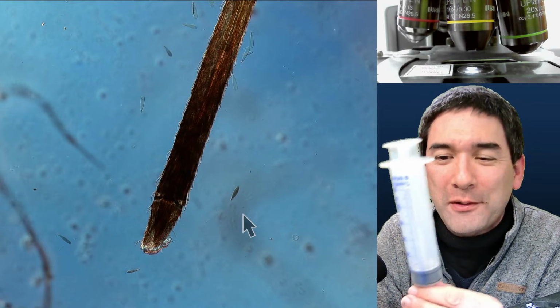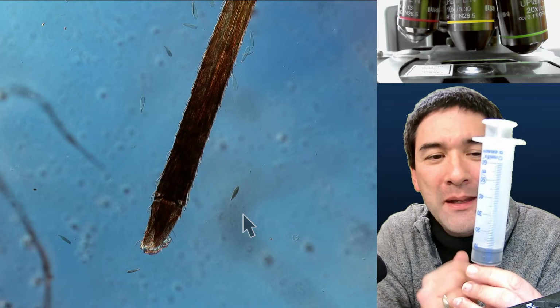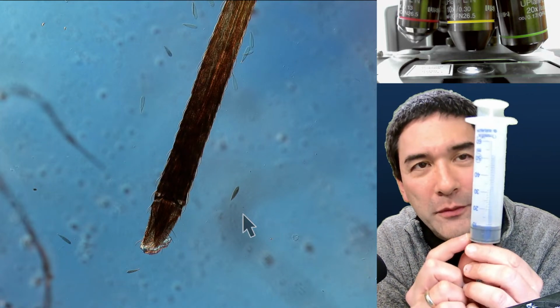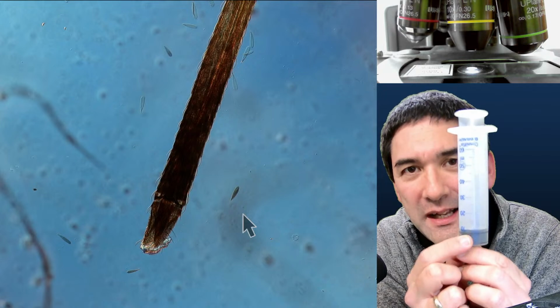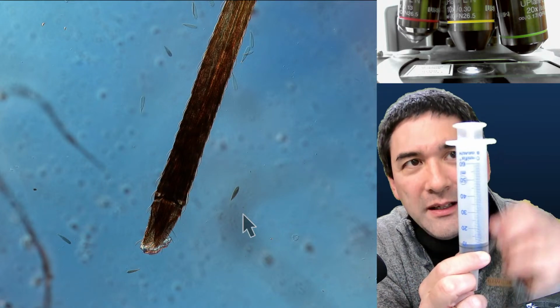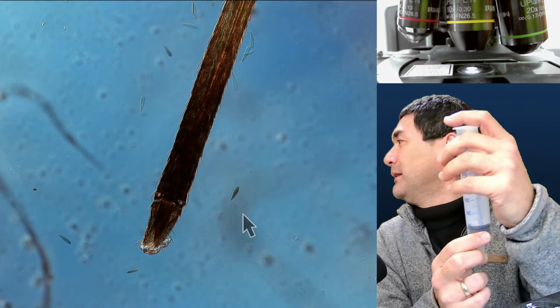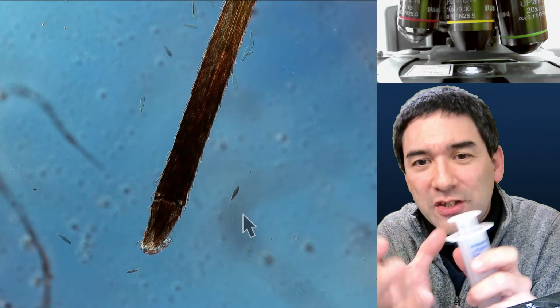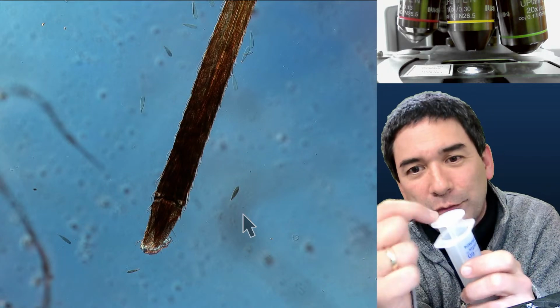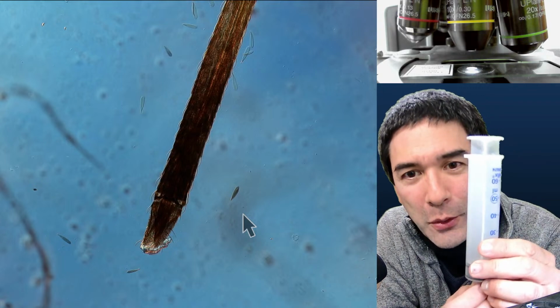Let's say that this is one of those elements of the compound eye. Basically it's like a tube, and on the bottom of the tube there is a light-sensitive cell. The light comes in from the top, and you've got many of those next to each other, arranged in a circle, and the light is able to enter from the top, and then it's picked up and converted to a nerve signal on the bottom.